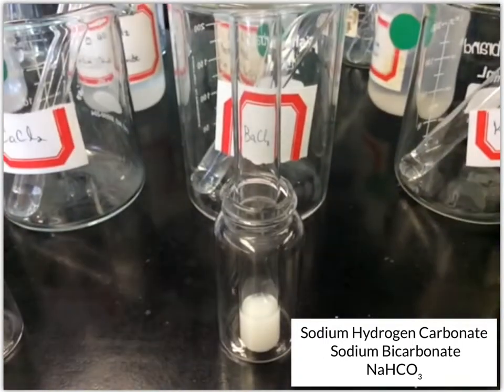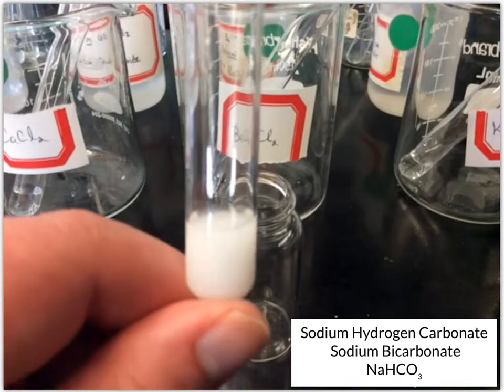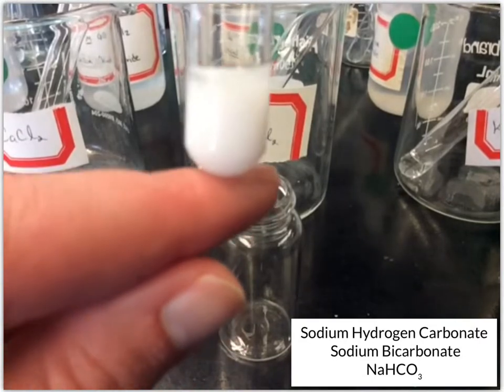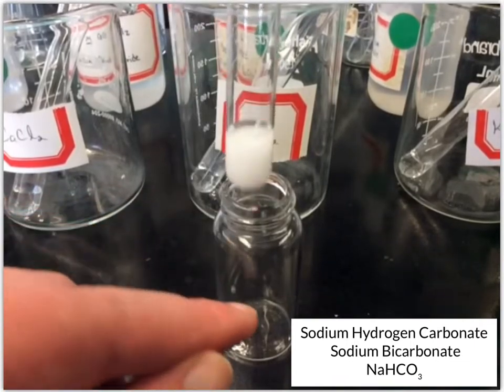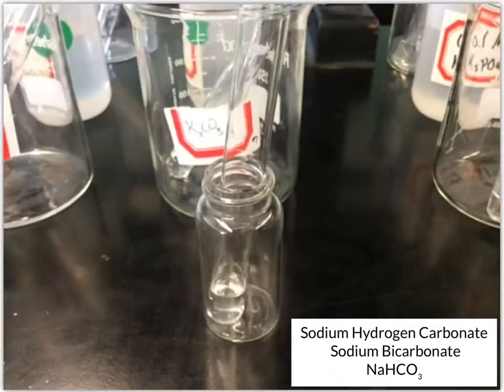And then the barium chloride. You see that little clear layer at the top? It is starting to settle. And so you do have some white solid that's slowly settling in that solution. So we've got, again, a white precipitate for the barium chloride.